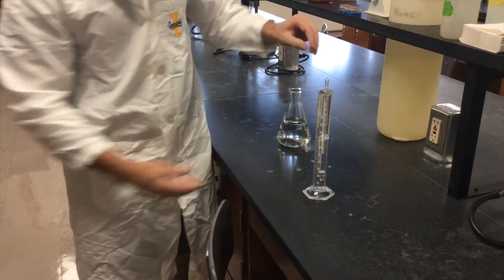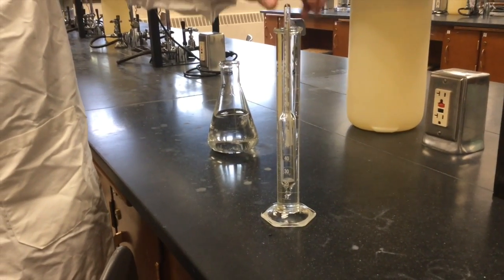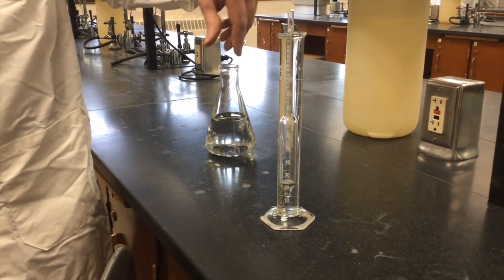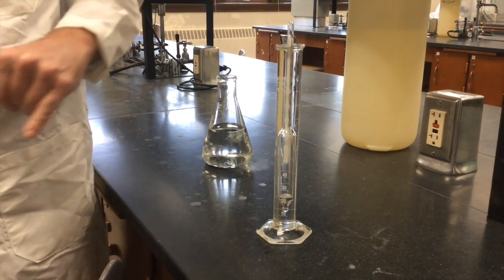Now you can see it's floating freely and it's away from the sides of the cylinder. You don't want it held up against the side — you want it in the middle. Sometimes you give it a little spin to help it get in the middle. And you read where the liquid surface interfaces with the scale of interest.